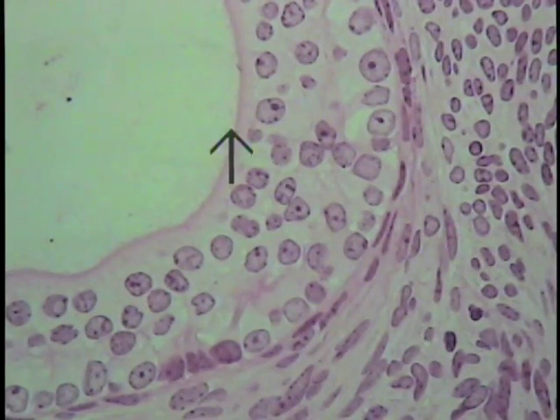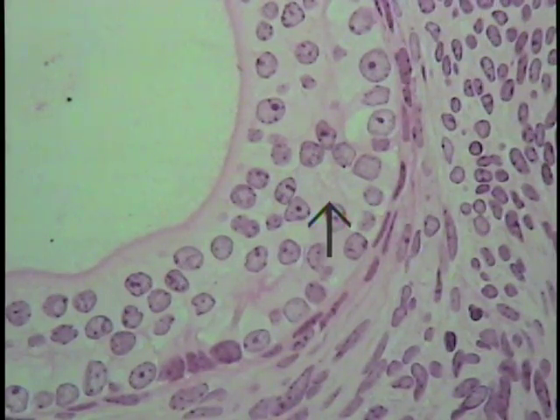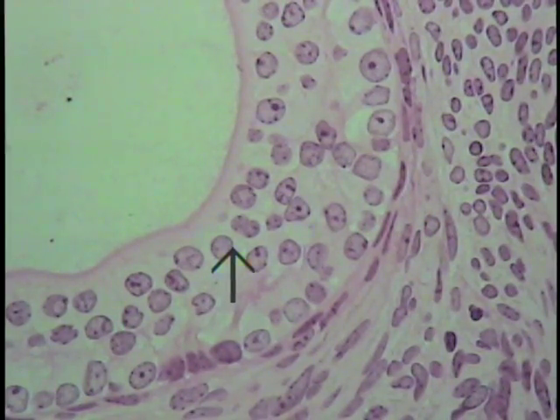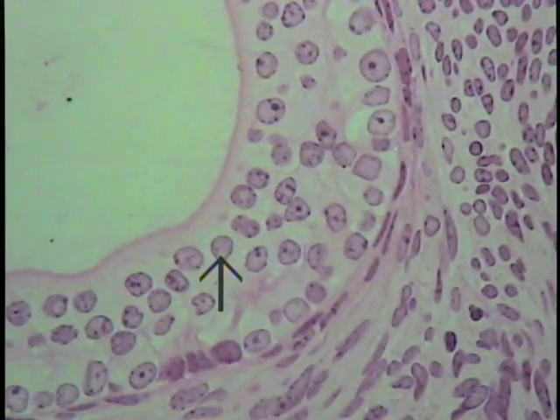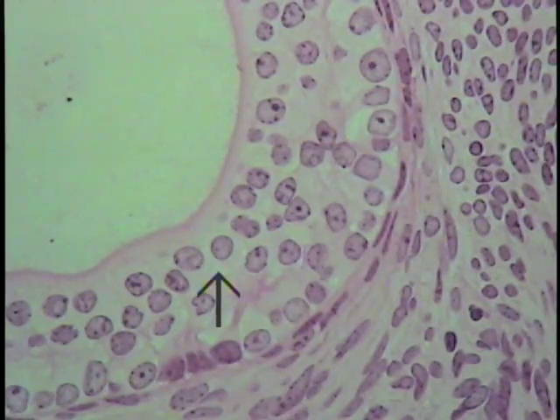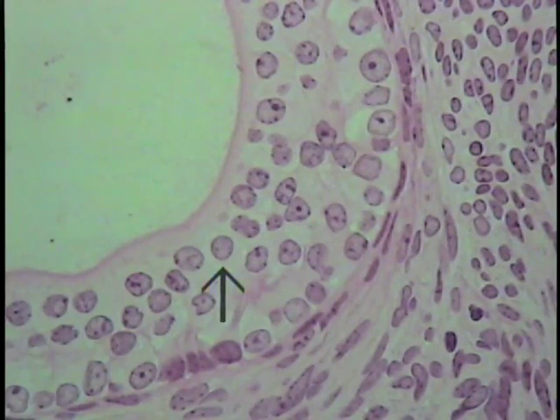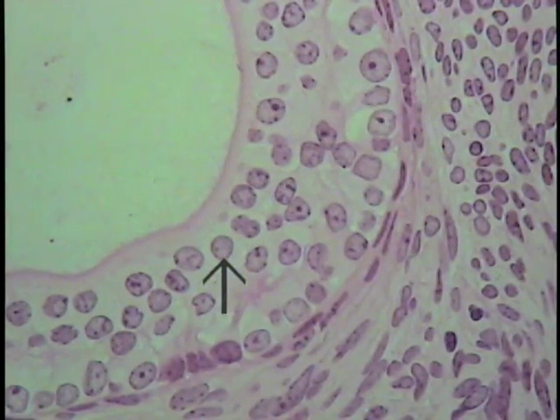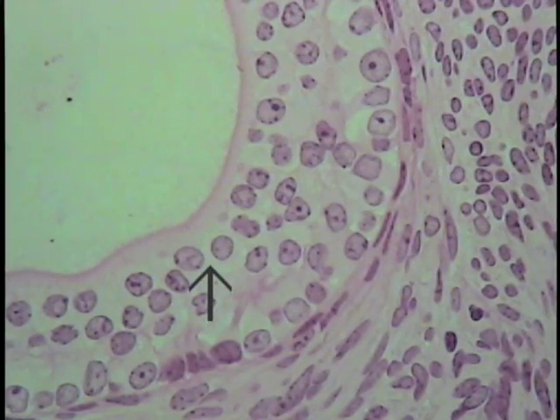Note that in some regions the cells are closely packed together and cytoplasmic boundaries cannot be discerned. When this condition is encountered, use the profile of the nucleus to give you an indication of the overall shape of the cell. The cytoplasmic boundaries are very indistinct but are approximately here, and are then somewhat estimated using the nuclear profile as an indicator.